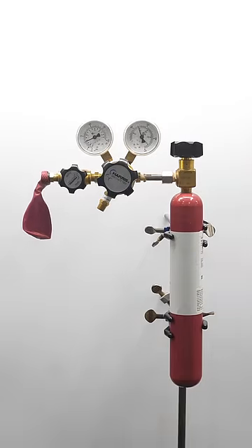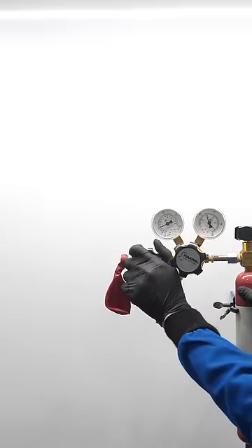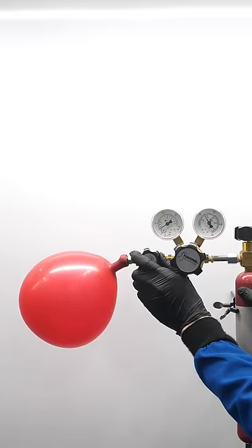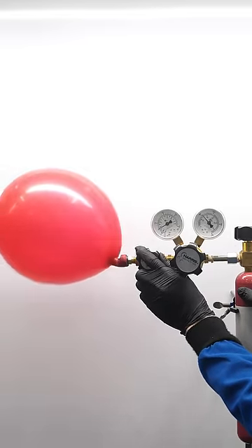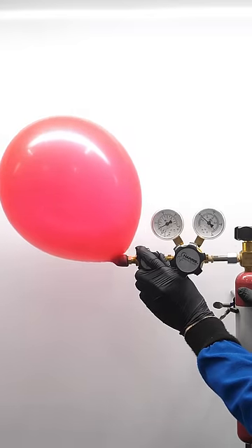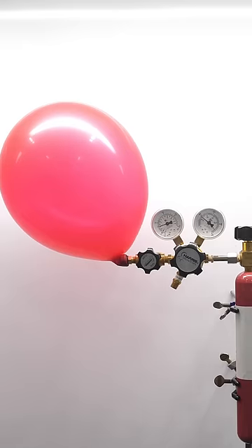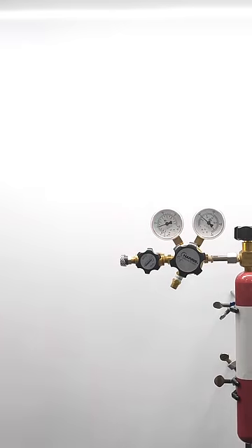Now I can attach a balloon and carefully open the valve. As the balloon fills with the hydrogen, it starts lifting up, just like it would with helium. The only difference is that hydrogen is even lighter than helium, and a lot more dangerous.